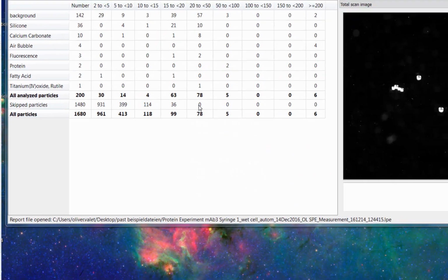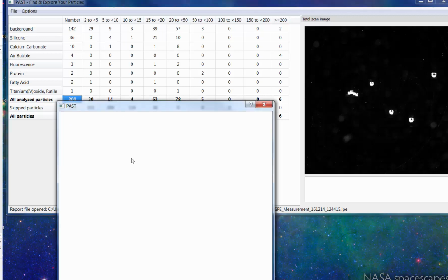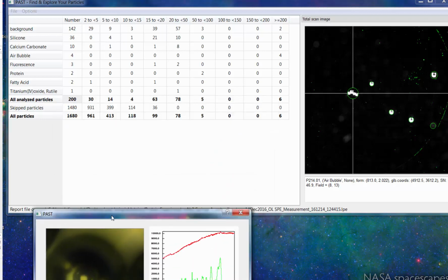In this example here, which is another file, and by the way, this is the format how you can reprocess data once you have recorded it with the single particle explorer. Here we have in total 1680 particles. All analyzed particles are highlighted now, and there were some larger air bubble regions. That's what you see here, and we see some smaller particles, and we were more interested in the smaller ones than in these air bubbles.